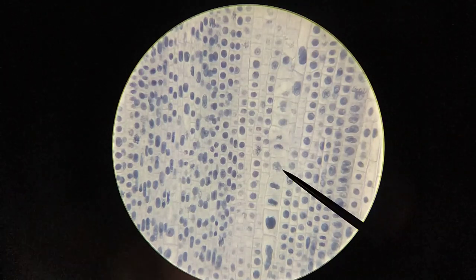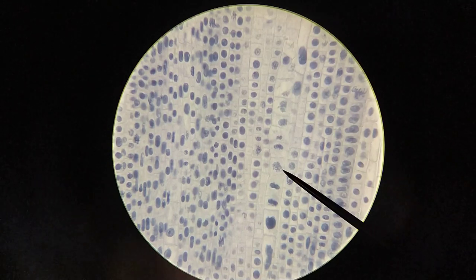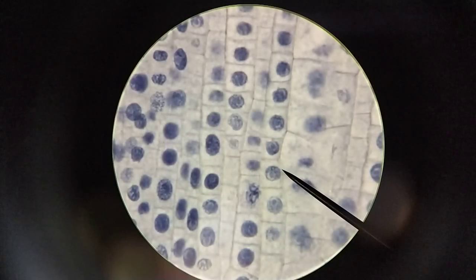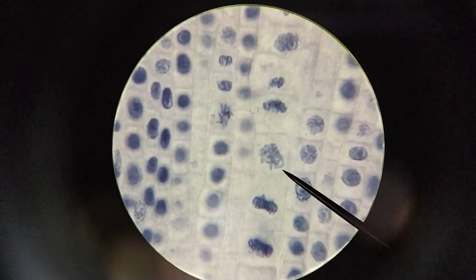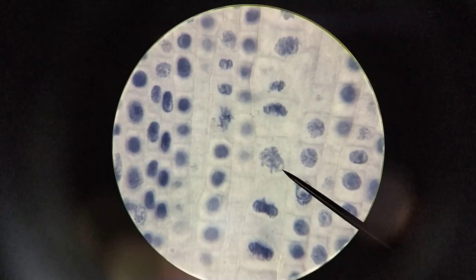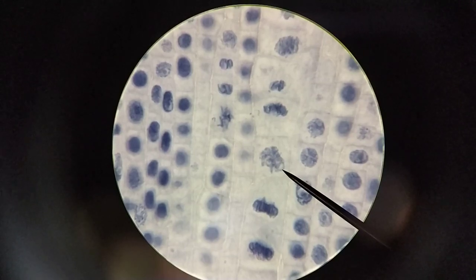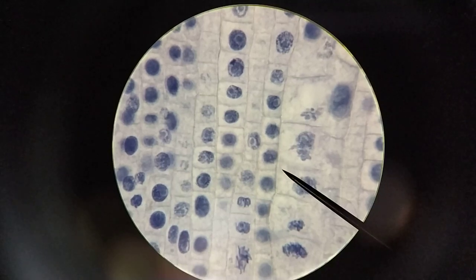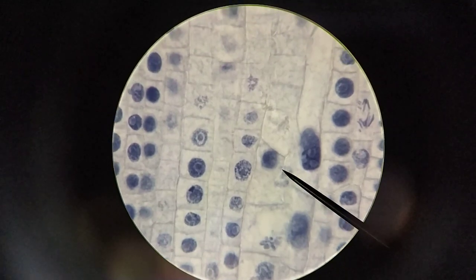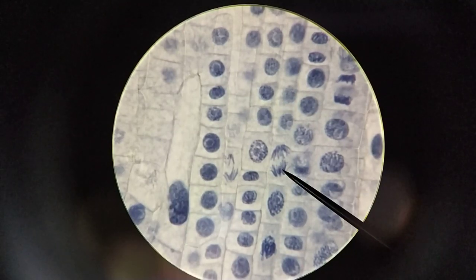What you're seeing here is a nucleus that is more broken apart - you're seeing chromosomes. Since we're at 400x and having difficulty seeing this clearly, let's zoom in to 1000x total magnification. Here is the nucleus I was looking at, and now instead of a nice round nucleus you can see individual fairly thick strands - those are the chromosomes. They don't look like the X-shapes from textbook diagrams; they're relatively long, thick structures, but small enough for the cell to divide them between the two poles.